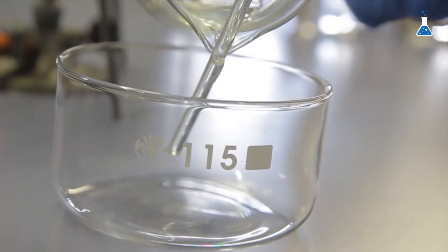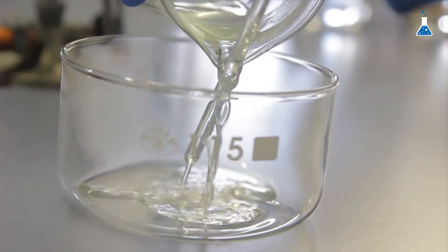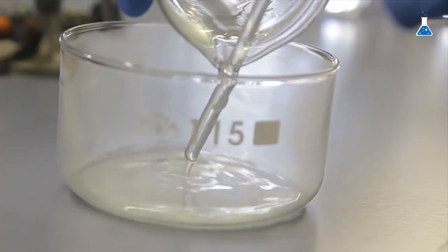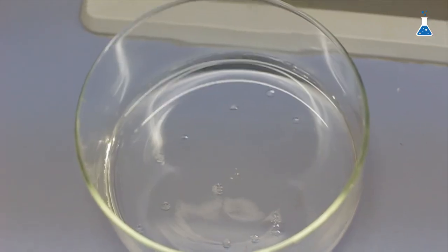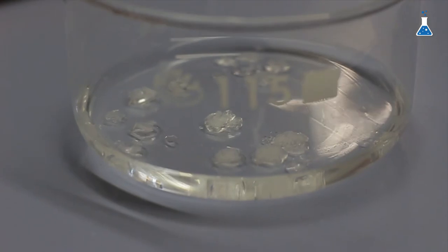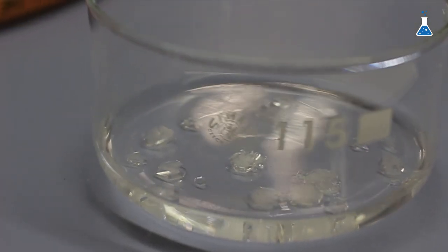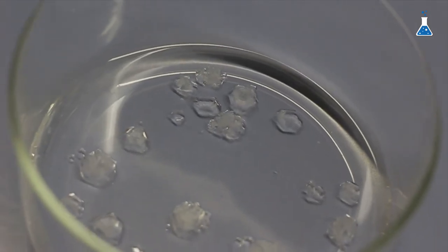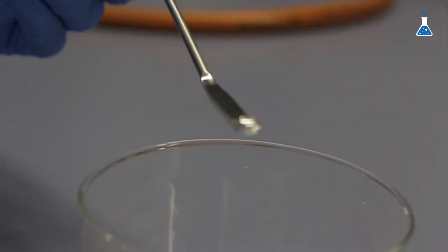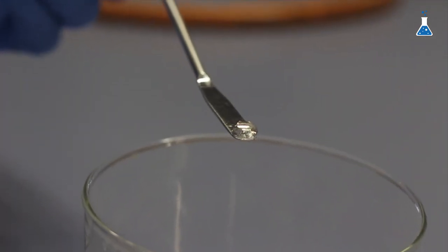Now, let's allow it to cool down the solution and recrystallize it during all night in order to ensure a better crystallization process. As you can observe, after around 12 hours, a beautiful set of crystals of alum have been formed. Can you advance which would be the pH of this beautiful double salt? Let's see if you are ready to answer that.